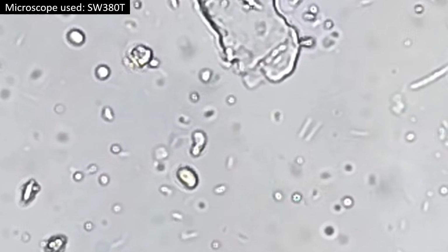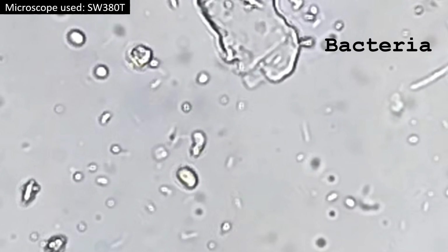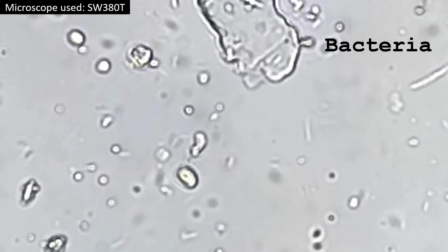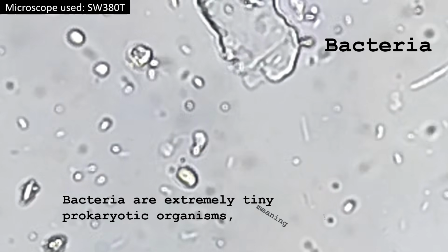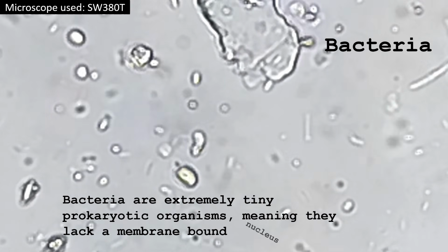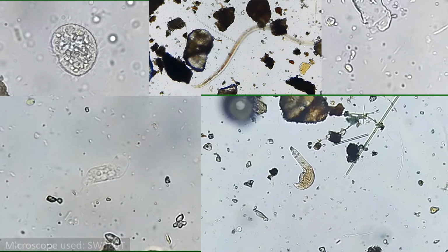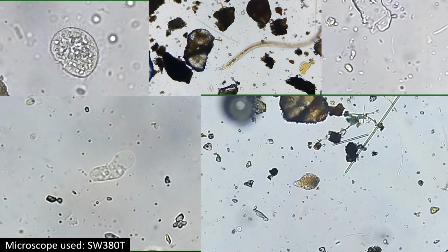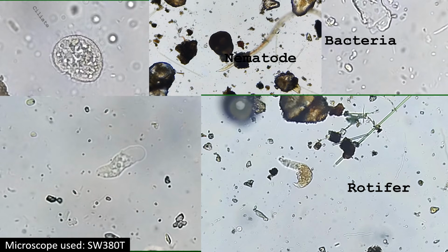But even tinier organisms inhabit moss. For example, bacteria. Bacteria are extremely tiny prokaryotic organisms, meaning they lack a membrane-bound nucleus. These are the microorganisms and microanimals that I most commonly find in my moss samples.